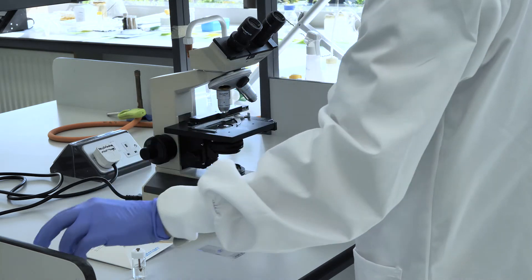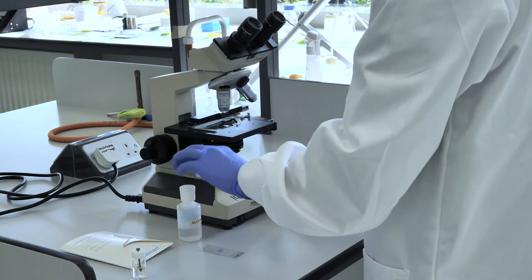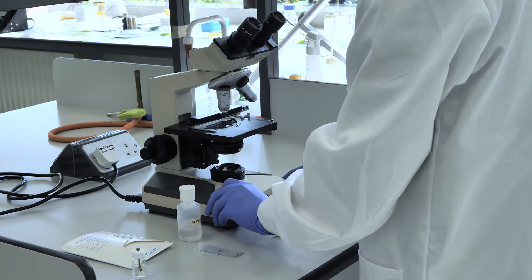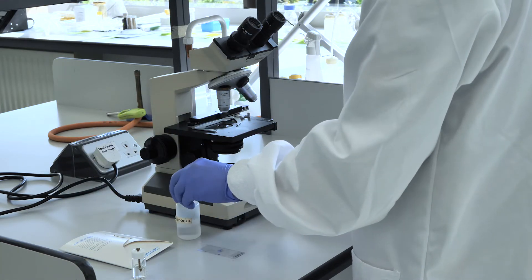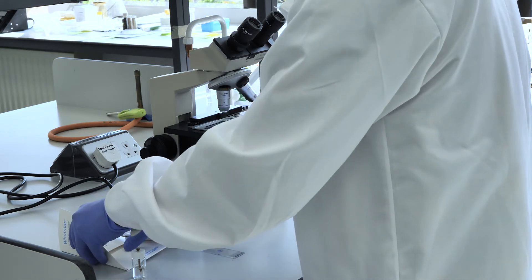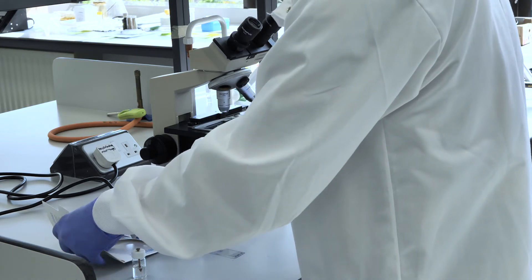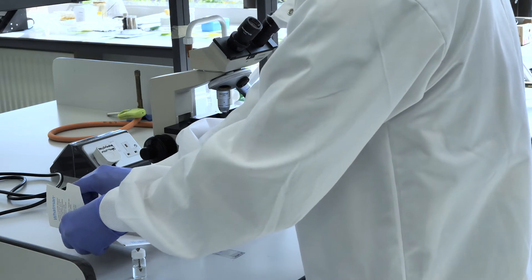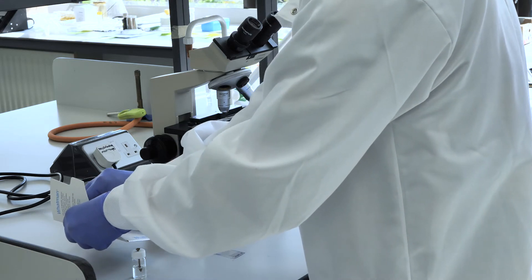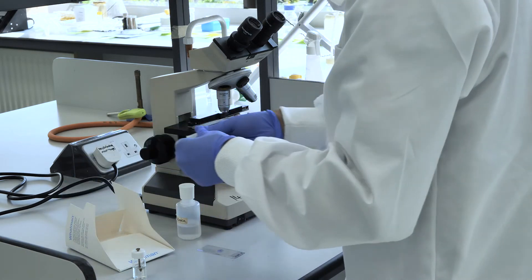After use, the microscope lens and stage will be cleaned with alcohol and special soft lens tissue by the demonstrators. Take care.